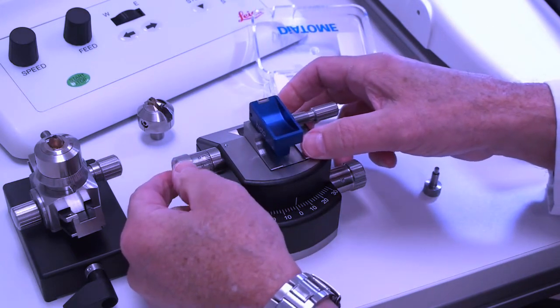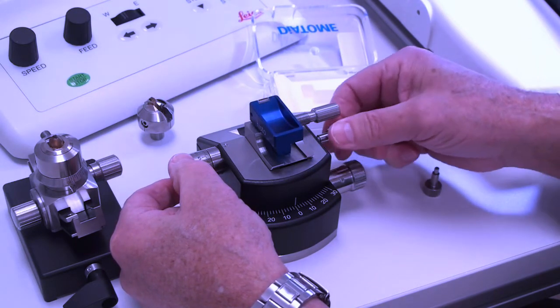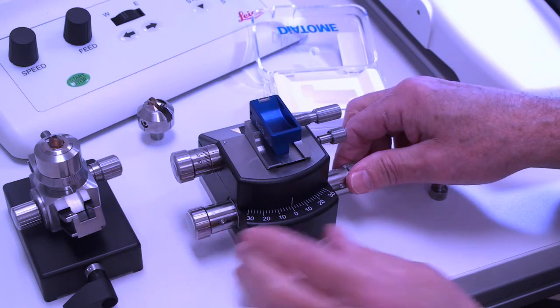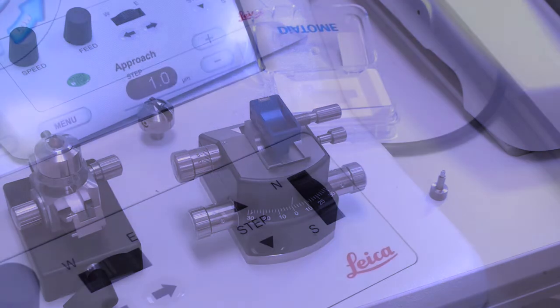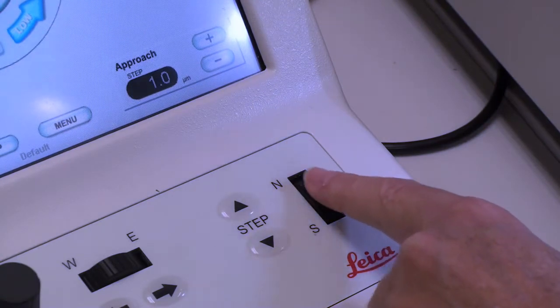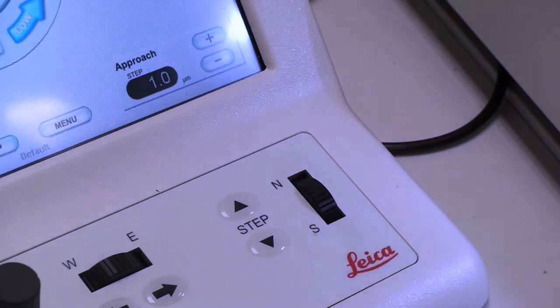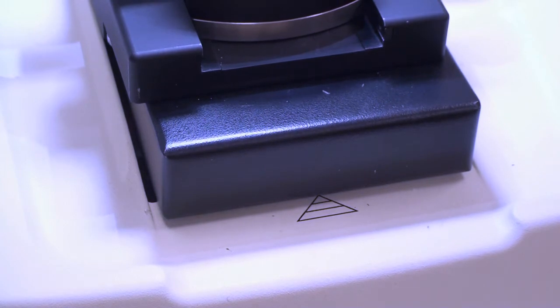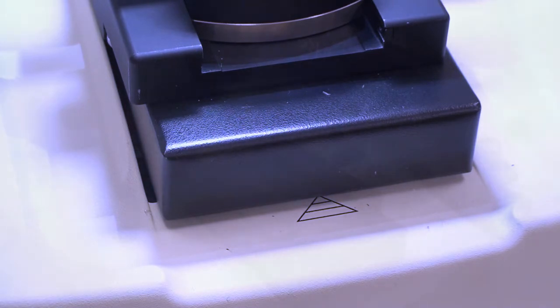Using our adjustment, we're going to set the clearance angle to 6 degrees. And that's an offset so that the block face does not intersect with the back of the knife afterwards. I usually set the knife arc at 0 degrees as well, and that's just a starting position. It's a good idea to always retract your manual advance so that you always have something to go by. When the specimen stage is fully retracted from the manual advance, that entire triangle will be covered.